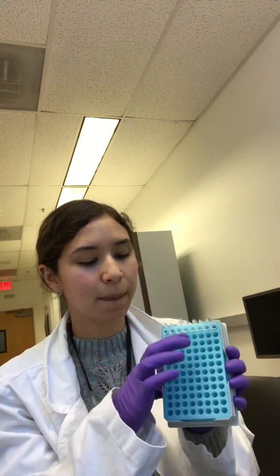So let's say our IPCR is almost completed in the thermocycler. We made our nested master mix. Now we want to make new strip tubes. So again, pop open all your strip tubes and put the right amount of master mix in here. So for 5S, you are now adding 24 microliters of master mix because you're going to do 1 microliter of product. We added them all in, and here are our 2 samples added on for our negative nesteds.